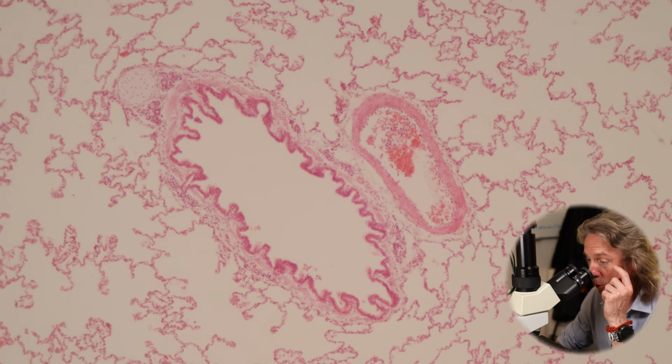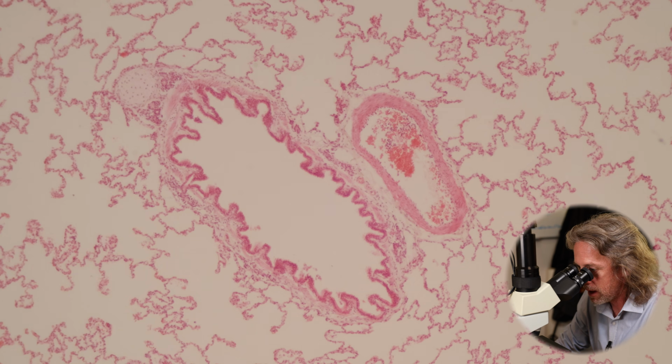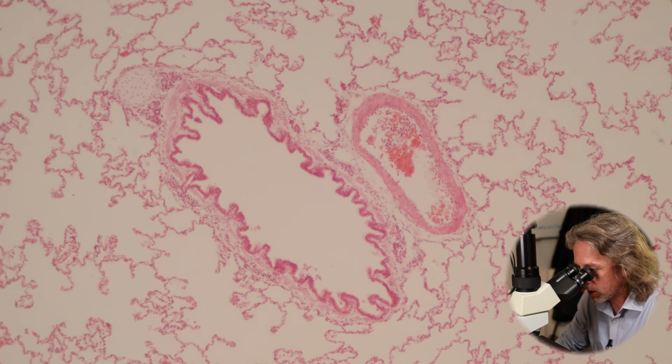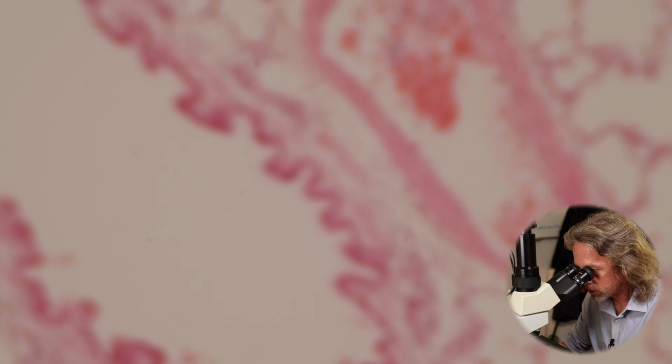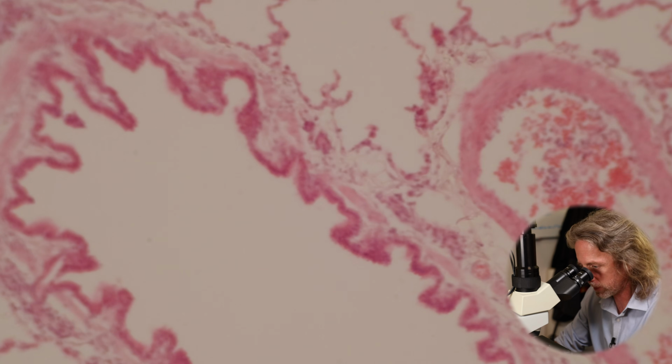And then occasionally we get tubes like this. We should look at this first because we were talking about the airways and the bronchi. So we've got blood vessels and we've got bronchioles. How could you tell which is which? Well, let's go back to the 100 times magnification. Can we still fit both of them in?